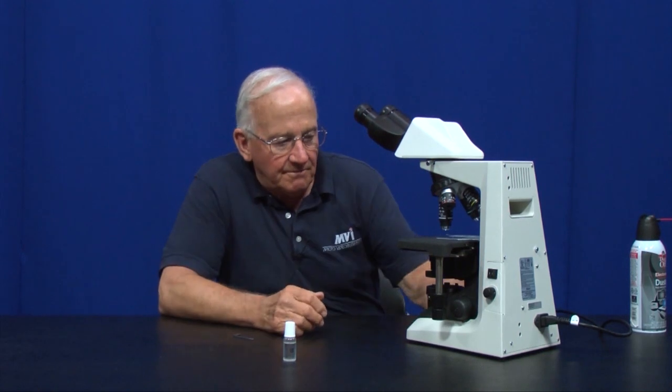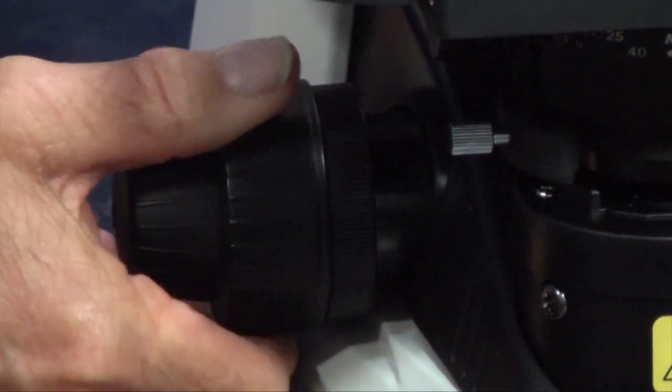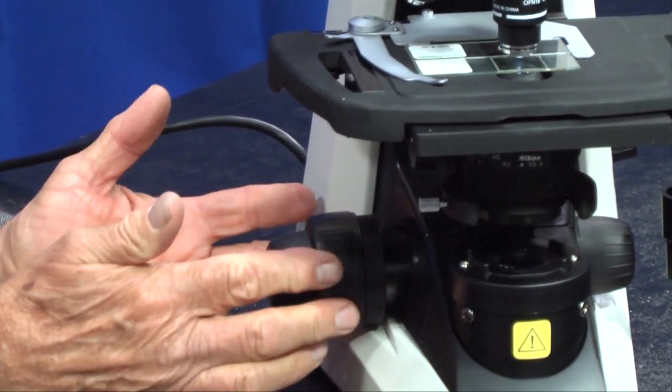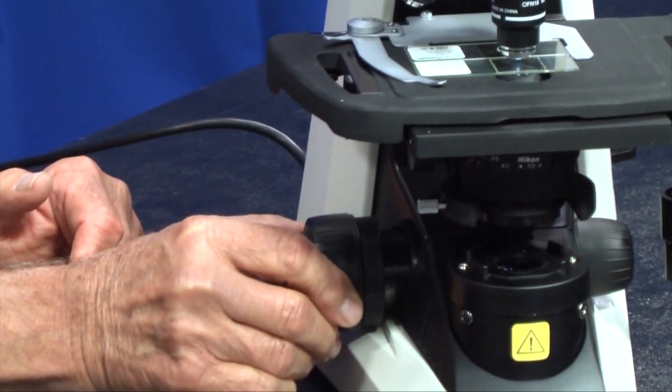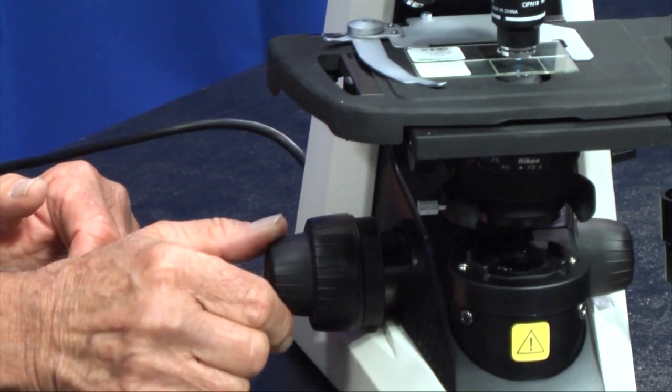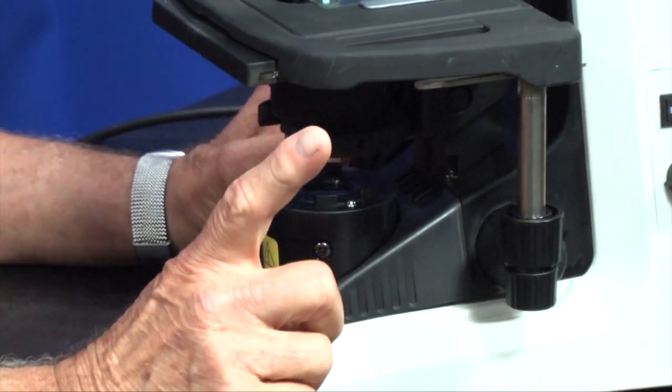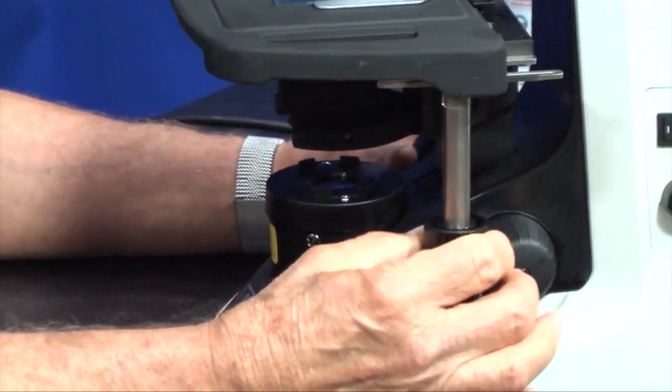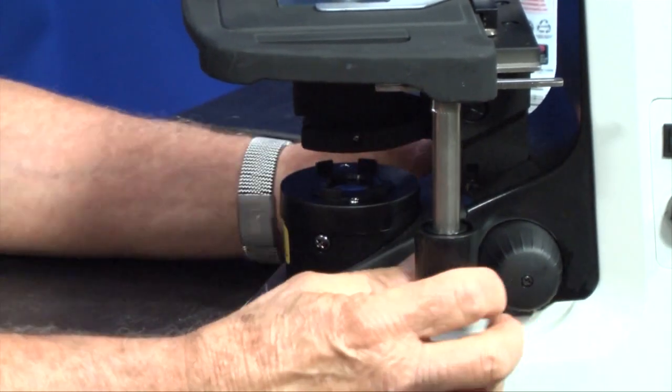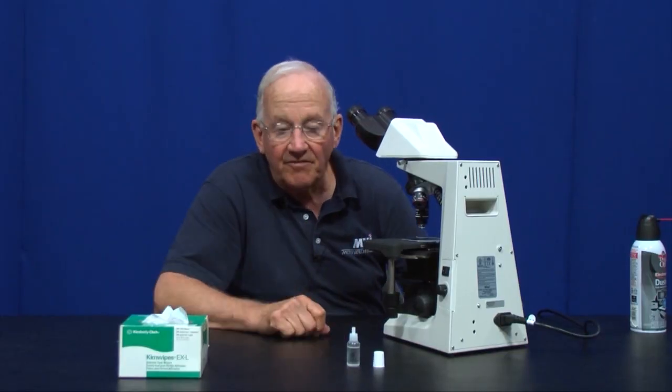Maybe one thing we haven't talked about is the fine and coarse adjustment of the microscope. That's the thing that makes the stage go up and down so you bring the microscope in focus. There's a coarse knob on this side and a fine adjustment. After you get it up where you think you might be close, you can fine adjust it with the fine adjustment here. There's two fine adjustments, one on either side. The reason why there is only one coarse adjustment is because they had to have room for the low drive stage. They thought it was important to have the drives of the stage as close to the table as possible so it would be comfortable to use the microscope.